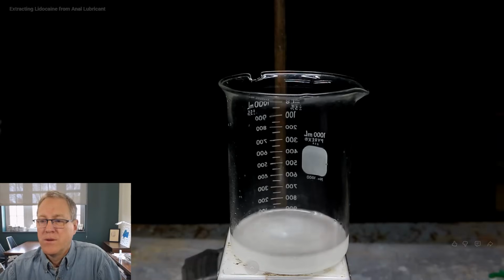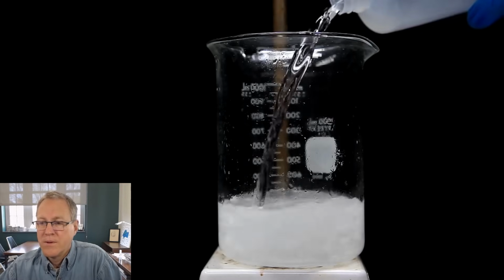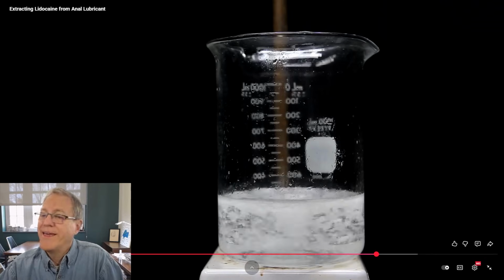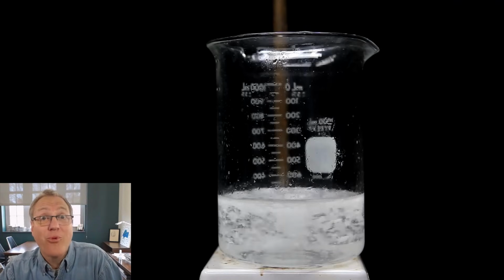That's okay, and we'll just keep adding water to increase the amount of lidocaine that's crashed out. And as we do this, eventually crystals will start to form like you see here. At this point, I kind of just went crazy and poured in a bunch of water. This happens. It gets tedious just to add dropwise, squirt, just dump it in and let's end this chase.